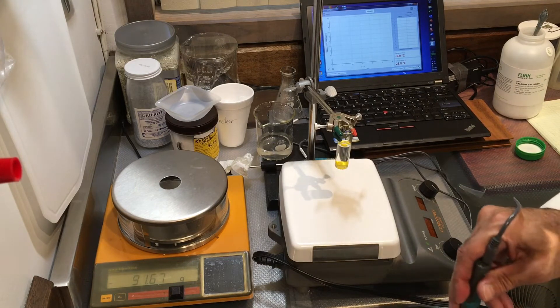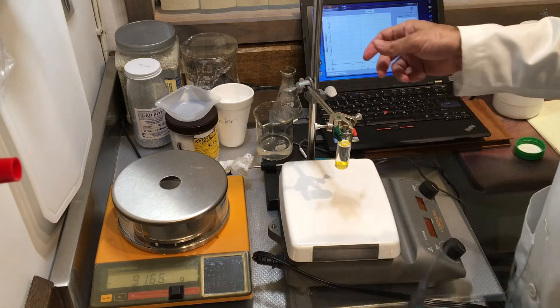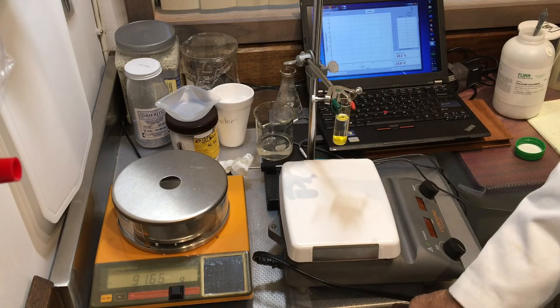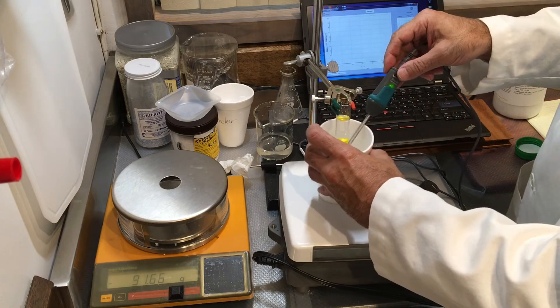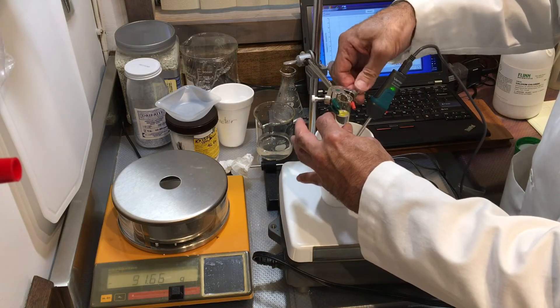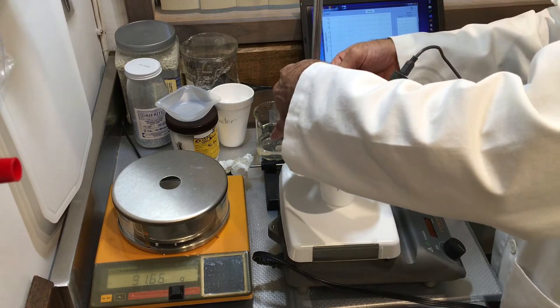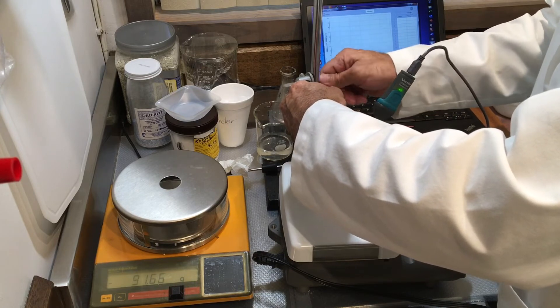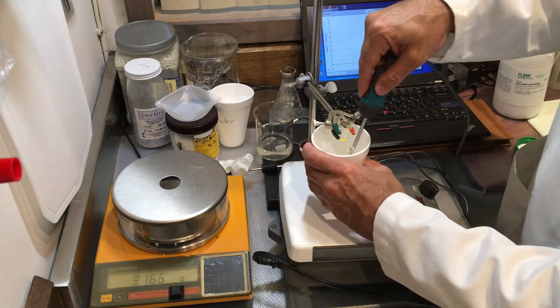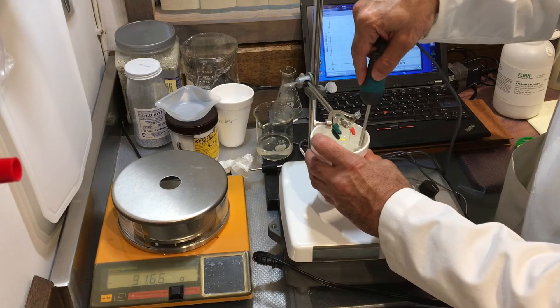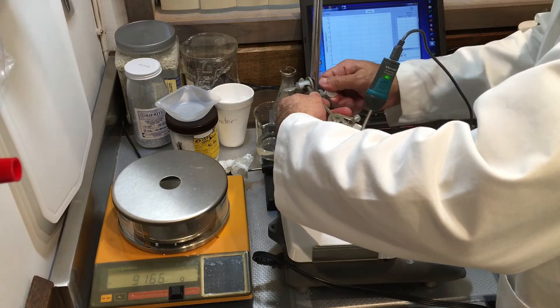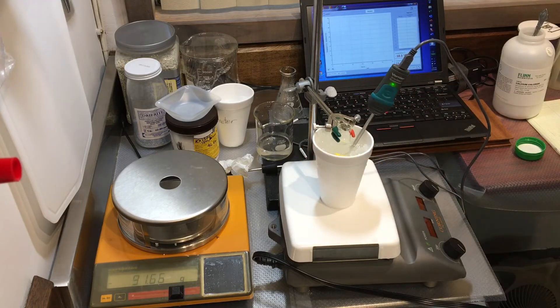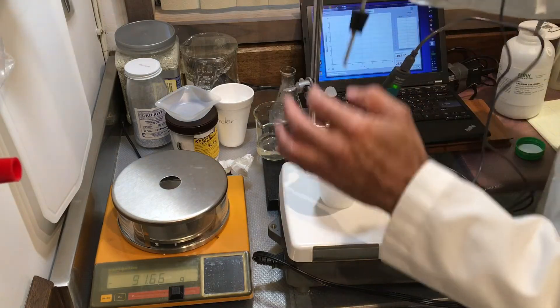My bath temperature is roughly about 10 degrees, so I can work with that. I want it probably colder, especially if I see the same nucleation effect, the seeding effect, or lack of seeding, I should say, that we saw the other one. Let's lower down our... should I spill some water in here? It looks pretty good.